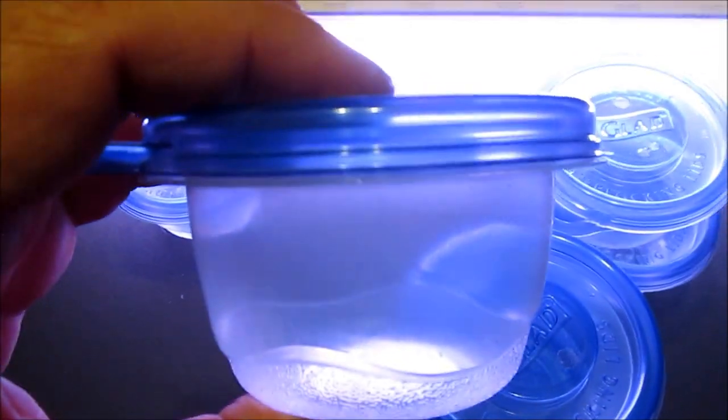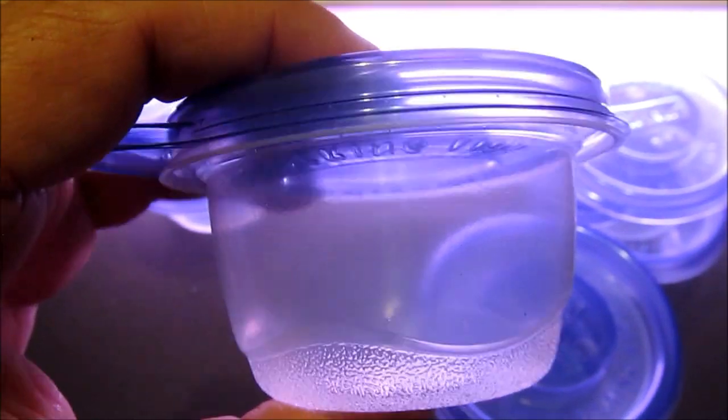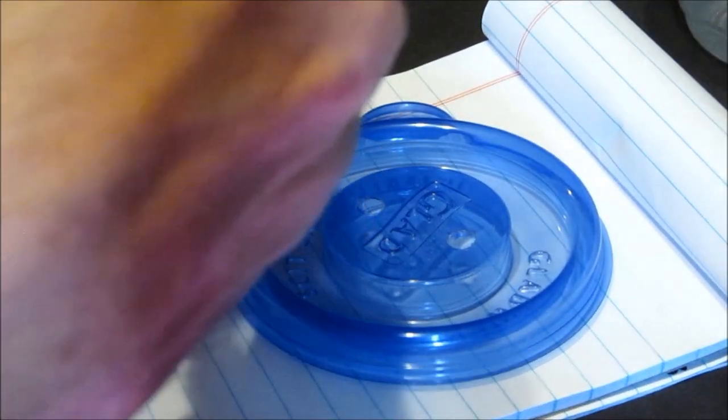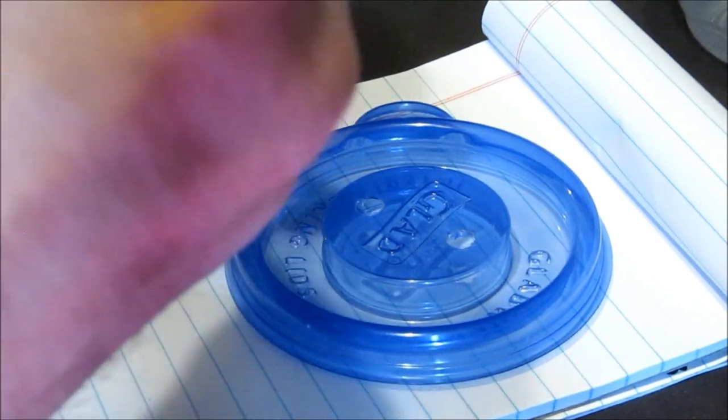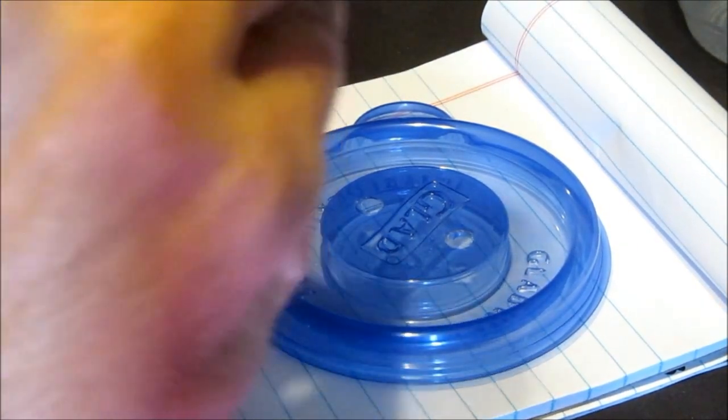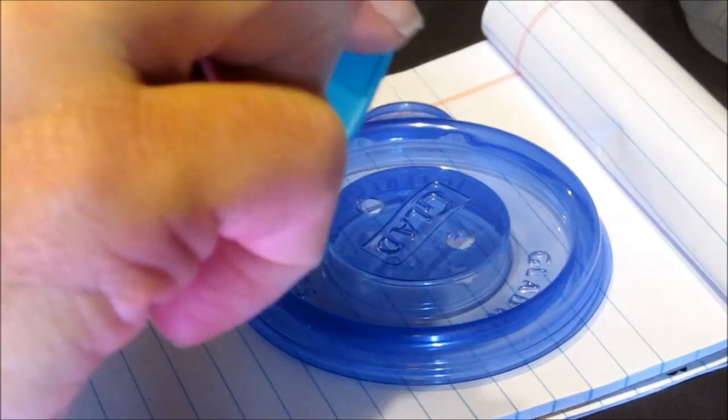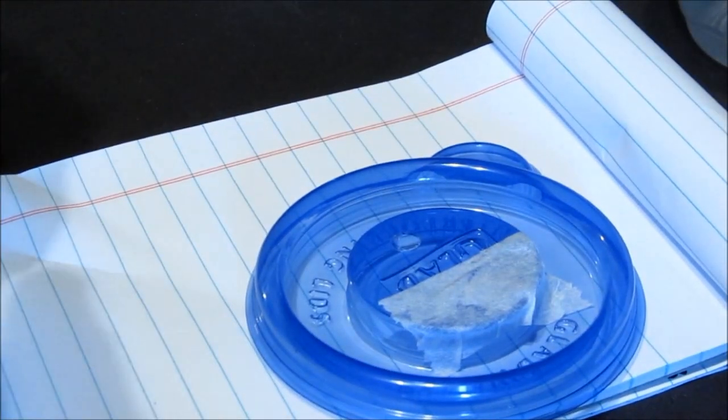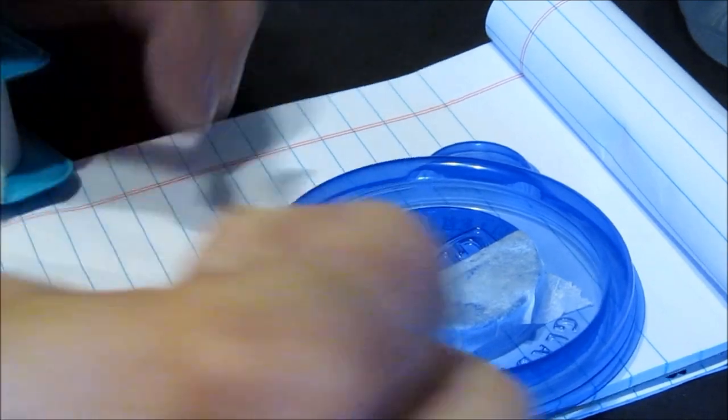About two and a half inches tall, two and a half inches or so wide. Easy, inexpensive way to get into agar. This is micropore tape - medical surgical tape - lets air through and keeps the bacteria and contaminants out. All you have to do is pull off a little strip, put it on there. I'm a little obsessive, so I like two. The second one can just be a small one.